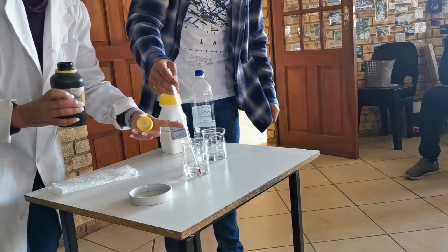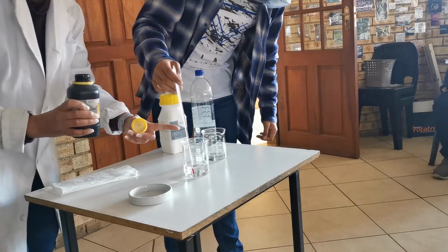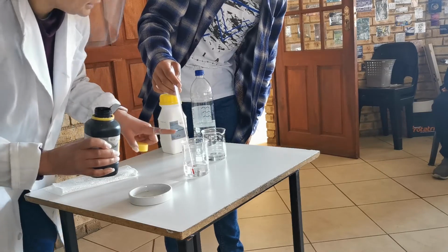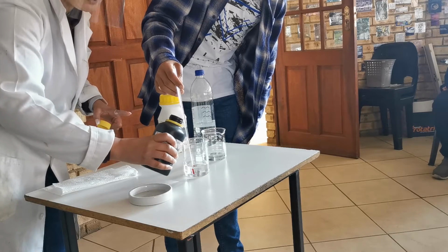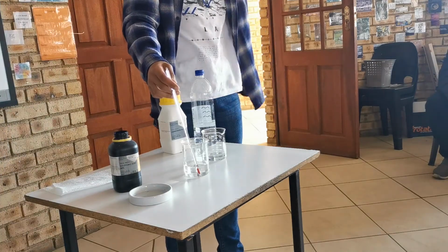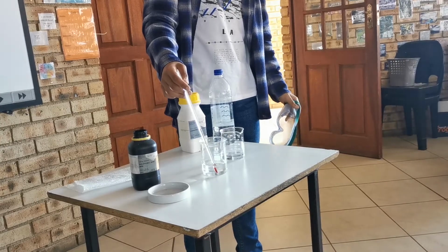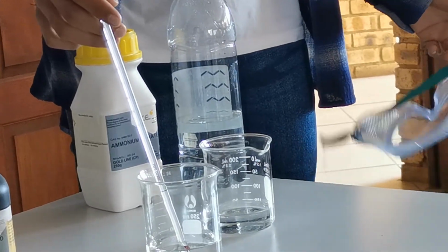Can you see where the red line is? Can you just watch the red line for a minute? It's at 10 degrees, which means it's down there. Are you watching the red line, Roman? Yes, ma'am. Can you see it on the screen? It's not focusing. I think we can almost see the red line now.